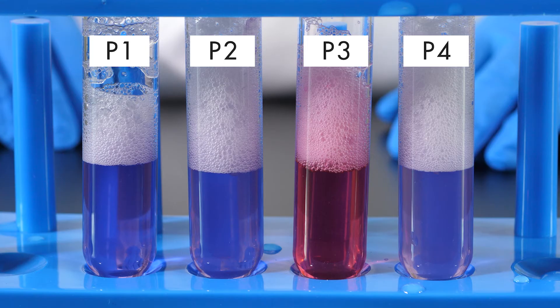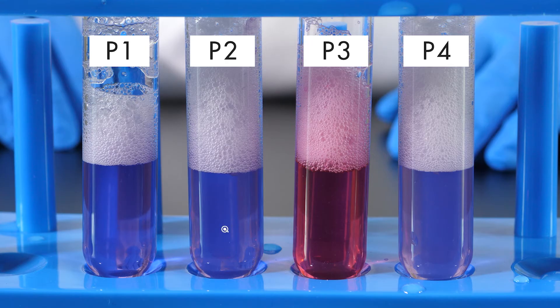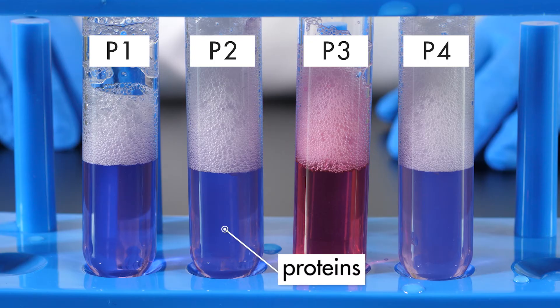The contents of test tube P2, albumin and the hydrochloric acid solution, also turned purple. Hydrochloric acid alone is not sufficient to digest proteins.